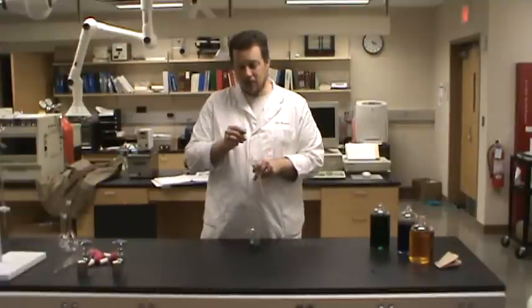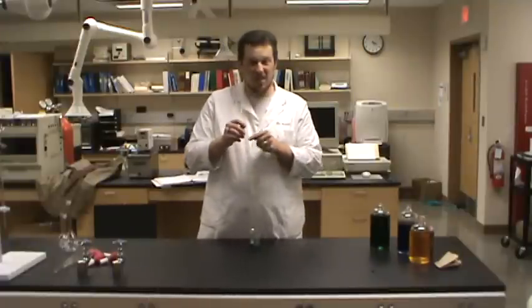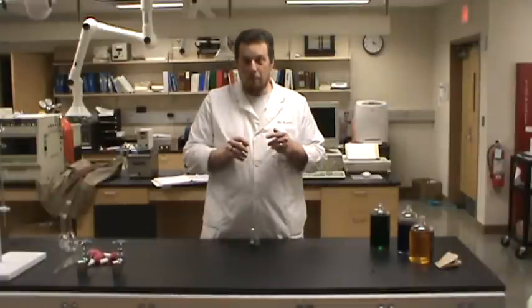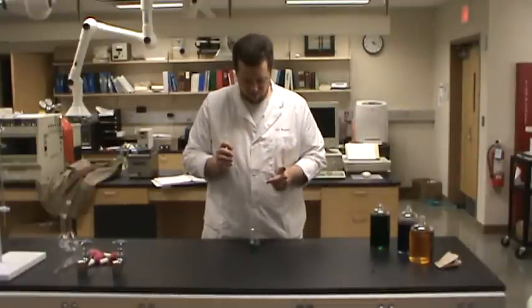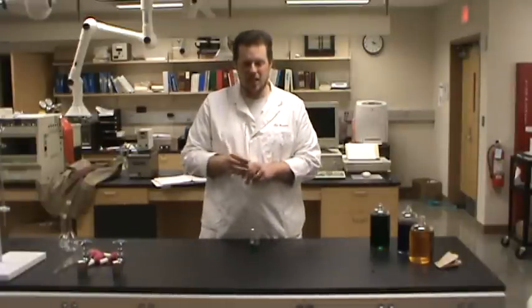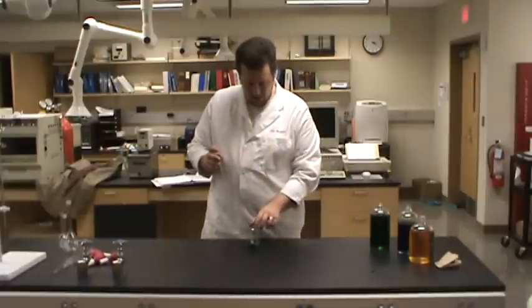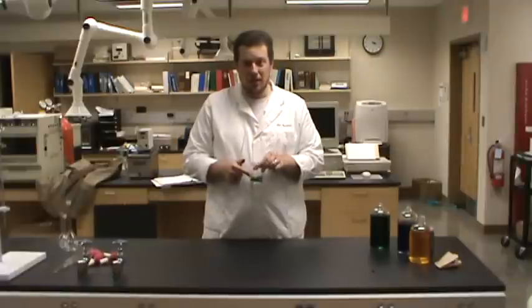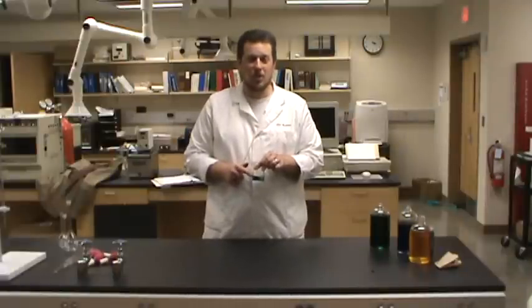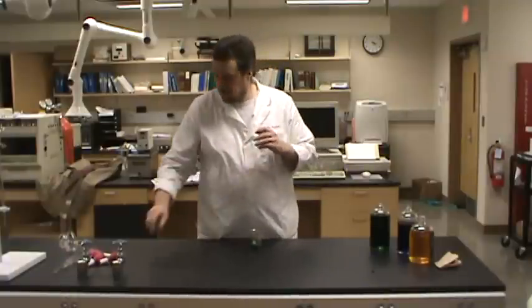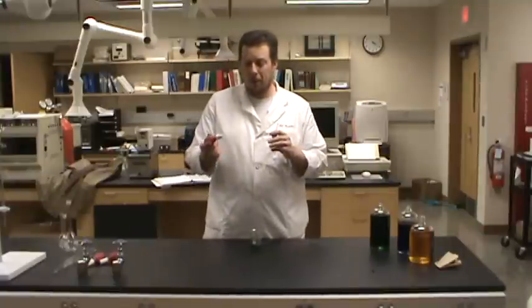Well, in the past, you would use this like a drinking straw. You'd stick it in there, but that's probably not a good idea because you don't know where this has been. And you're probably going to be using liquids that are a little bit more hazardous than green food coloring in water. So rather than mouth pipetting, we're going to use a pipette bulb.